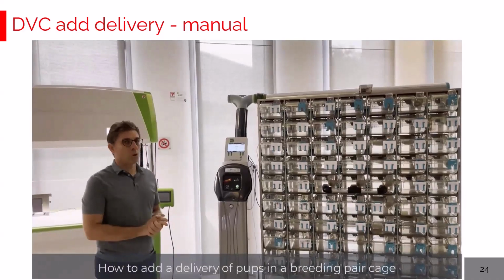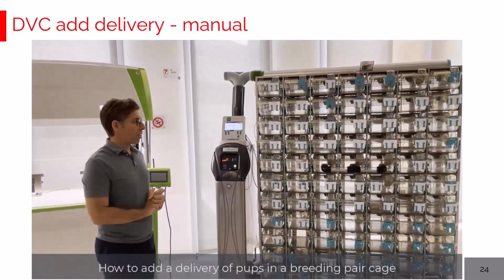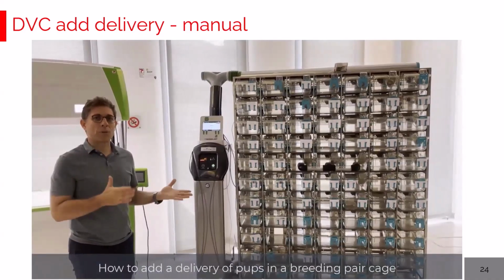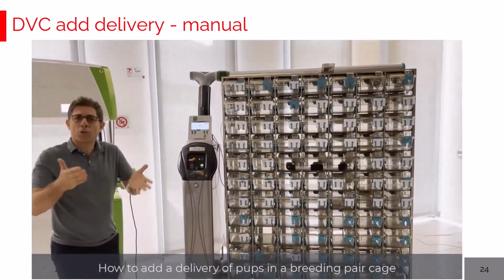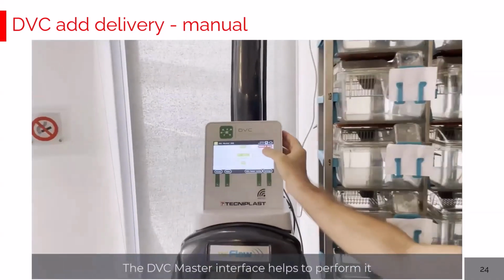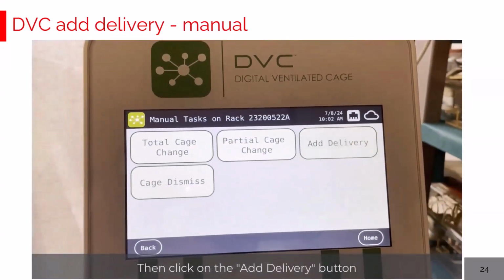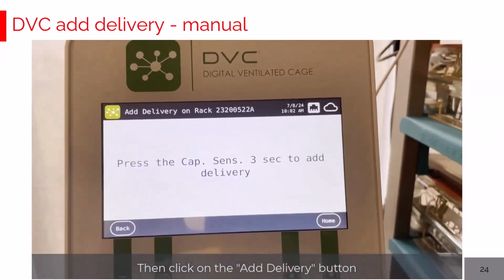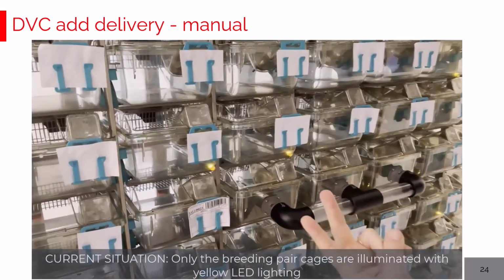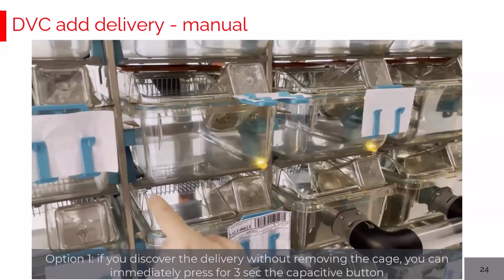In case you want to manually handle the potential delivery of pups in breeding pair cages, there is the opportunity to do it manually. It could be for any reason. You are anticipating the outcome of the temporal algorithm for breeding cages, or you are simply handling these types of cages manually. There is an opportunity through the DVC master interface by going under the manual task section, clicking add delivery. Now only the breeding pair cages are illuminated by yellow, and you have two options for telling the system that now there are pups and the delivery should be added to the corresponding cage.